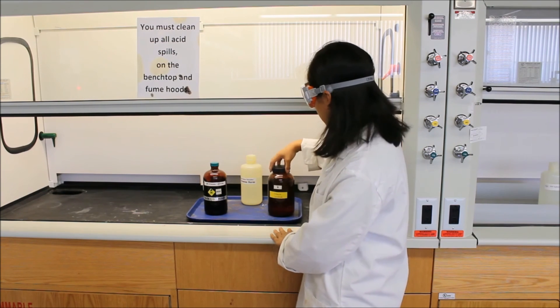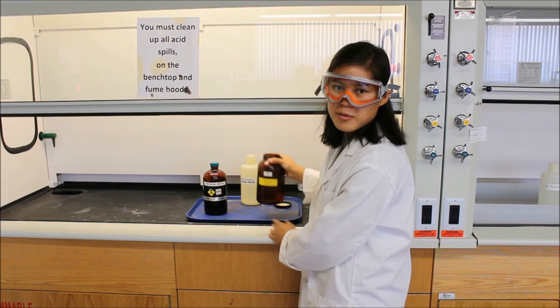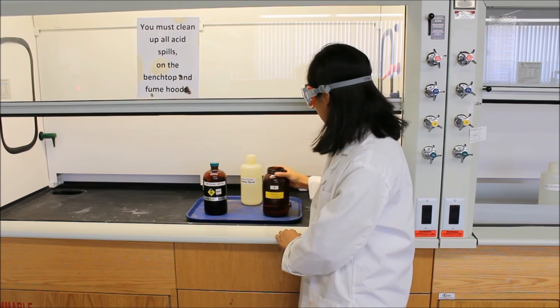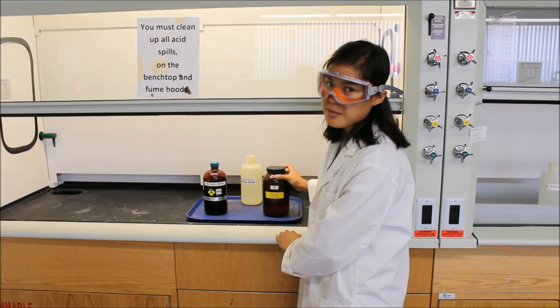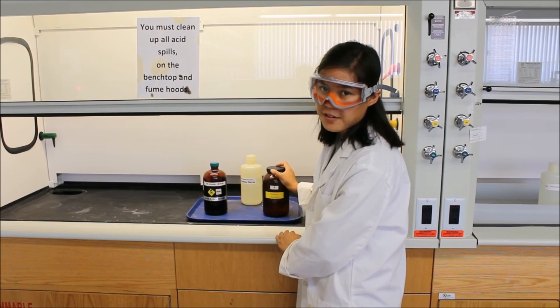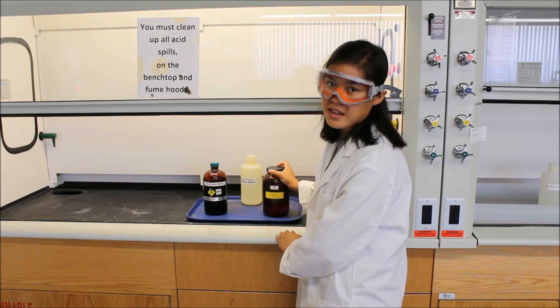After you're done with the waste, you want to put all bromine waste into this bromine waste bottle. Remember, you don't take any of it out of the hood because it smells really bad and it's very harmful for you to be smelling this stuff.